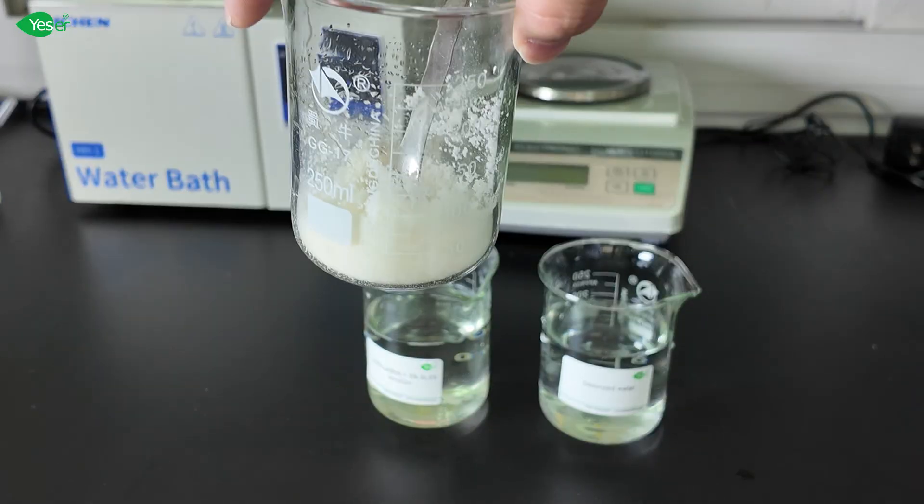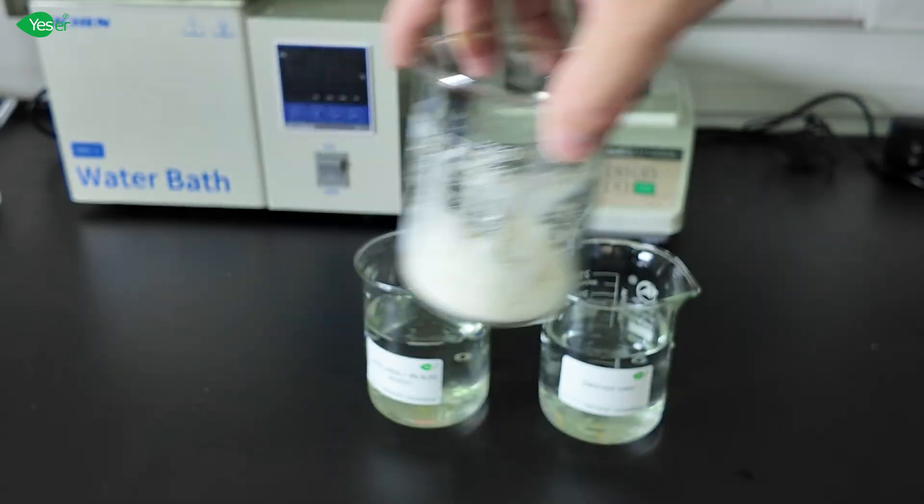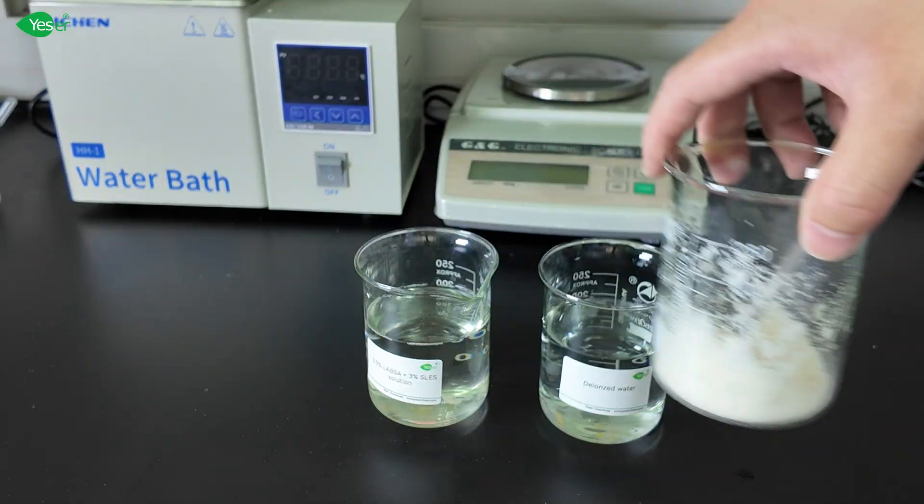Now, I will add this pre-wetted HPMC salt mixture to both beakers and see how the mixture dissolves.